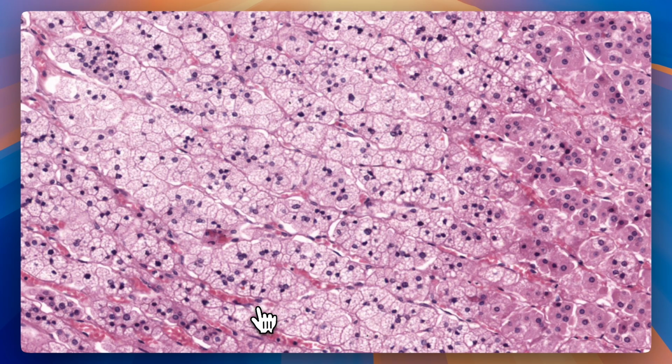The cells in this zone produce glucocorticoids like cortisol, which are involved in stress responses, immune responses, right? And the cord-like arrangement of these cells maximizes surface area and allows these cells to secrete and distribute their products via the bloodstream right away, so that your body can induce a stress response immediately if it needs to.